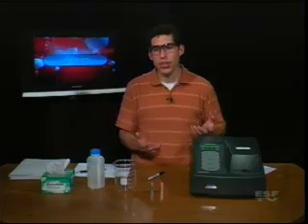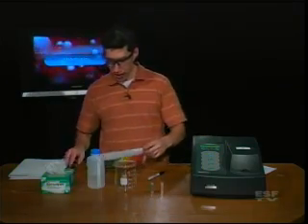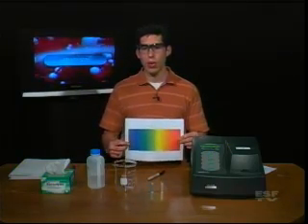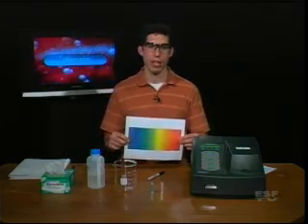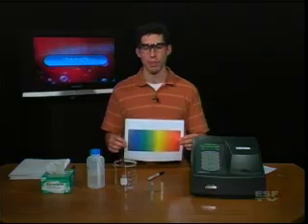So what does a spectrometer do? It measures the amount of light that's being absorbed or transmitted through a solution. And you may have seen a picture of the visible spectrum before, and this just goes from blue to red. And all of these wavelengths of light can be separated by the spectrometer, so we can look at just one specific color.